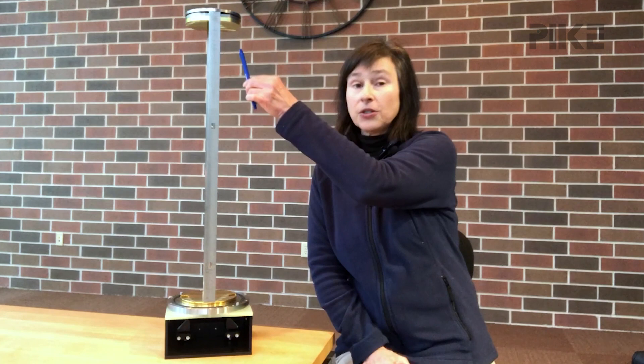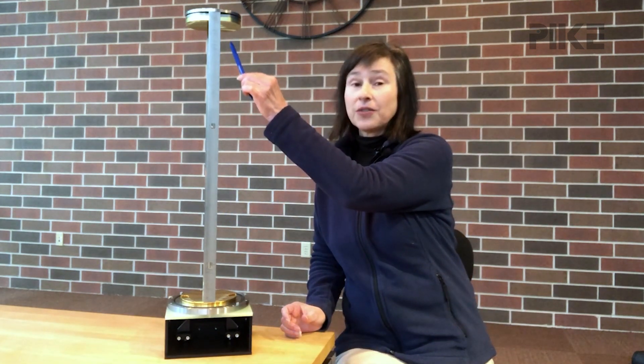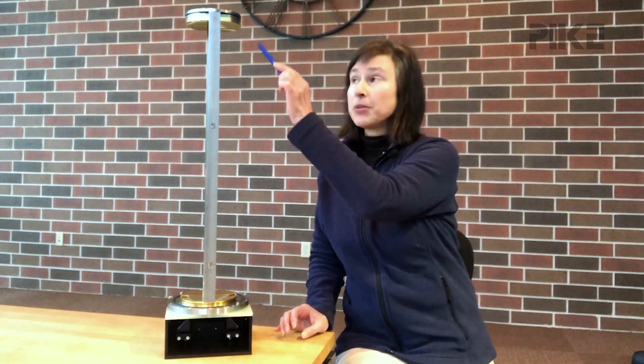When you receive your gas cell, my tip is to adjust only the output mirror. That output mirror to the FTIR detector may be on the left side of the instrument or on the right depending on the manufacturer. We want to adjust only the output mirror because if you adjust the input mirror, we've already laser aligned it and it's designed to hit a certain point in the gas cell. If you start moving the input mirror, you're going to start moving the beam — especially with these longer gas cells, you can really change the travel once it hits the top mirror. So adjust only the output so the beam will go up where we expect it to be and reflect between the top mirror and bottom mirror until it reaches the path length that you requested.